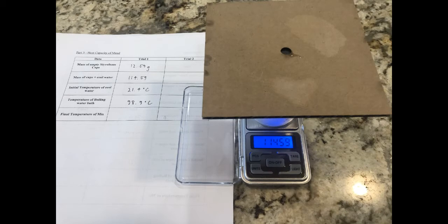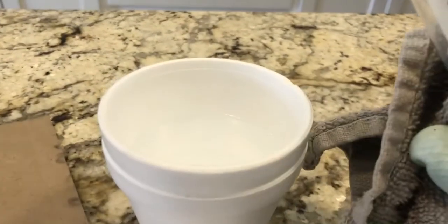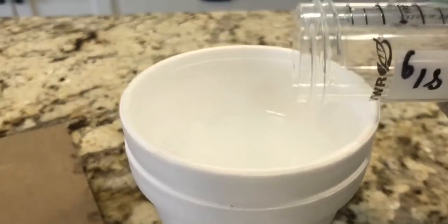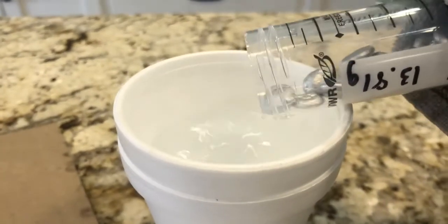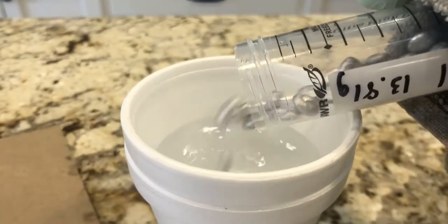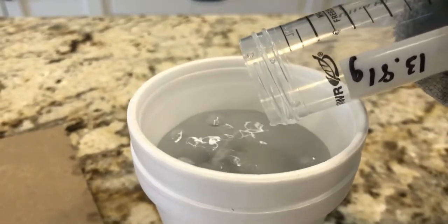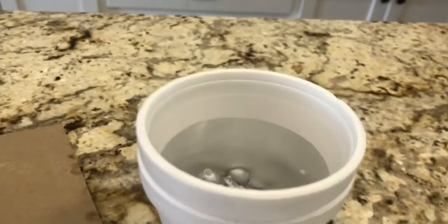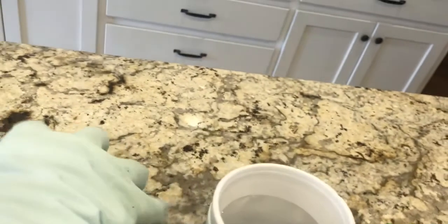After adding 100 ml of water, re-mass the calorimeter with lid to know how many grams of water you have added. I'm carefully adding Trial 1 to my calorimeter without splashing, and then I will replace the lid and put my thermometer in.